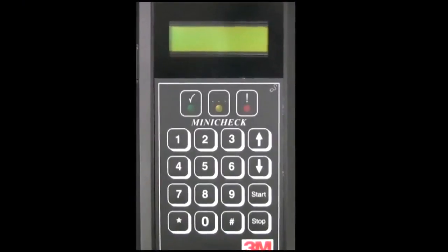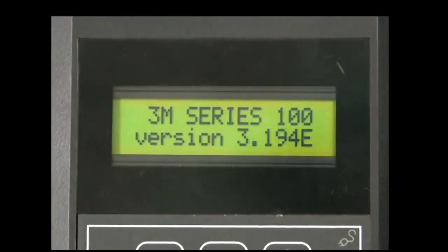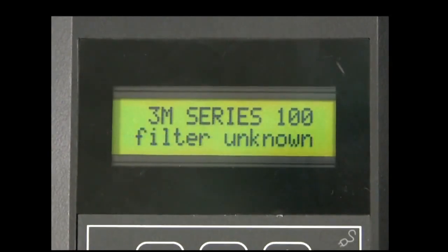The 3M Series 100 Automated Integrity Test device is activated via the button located on the left side of the device. After this button is pressed, it requires approximately 5 seconds before startup information appears on the menu screen and it's verified the device is operational. Pressing the button again prior to the startup messages appearing on the display screen will result in the device being deactivated.